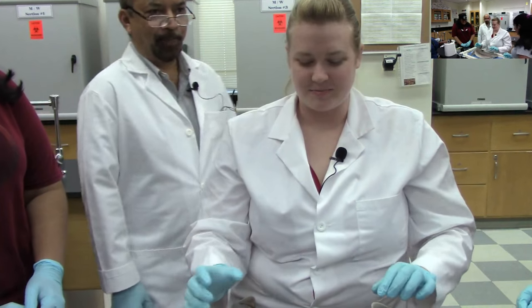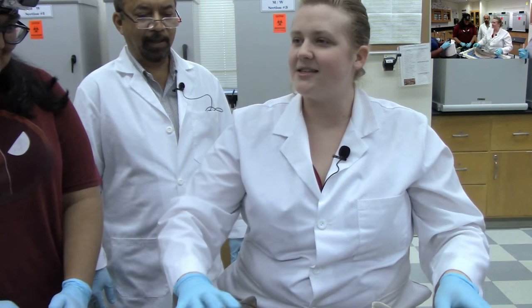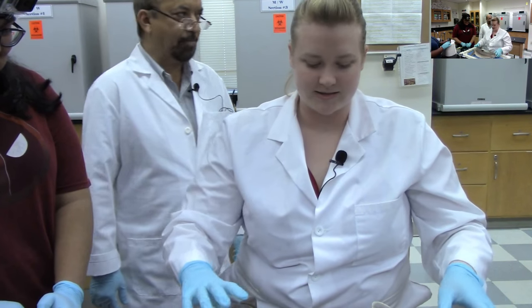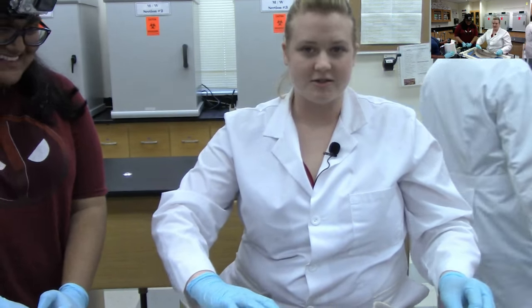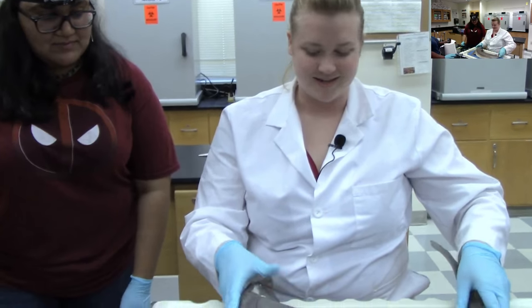We're going to focus in on the camera. Amber's going to take you through it. It's actually a learning experience, but really gross at the same time. Don't listen to him, take biology. He said pig, but it's not a pig. We've got Dr. Sadiq here doing a pig also. First time in our college history, we've got dual dissections going on. This is great.